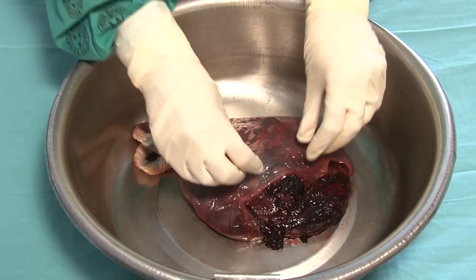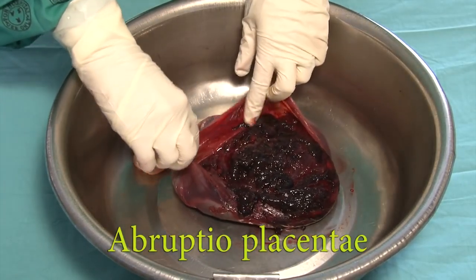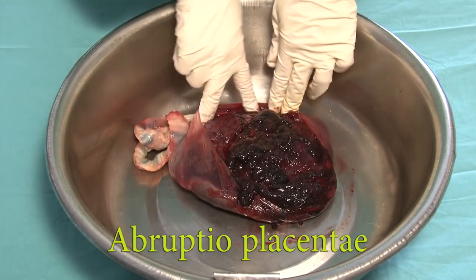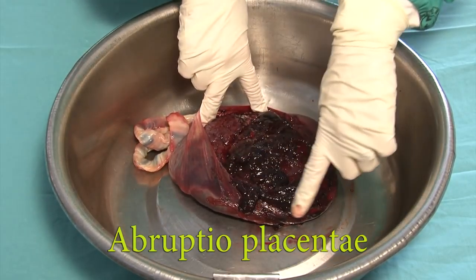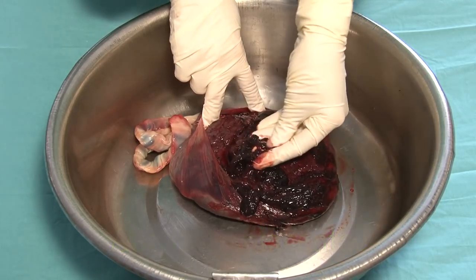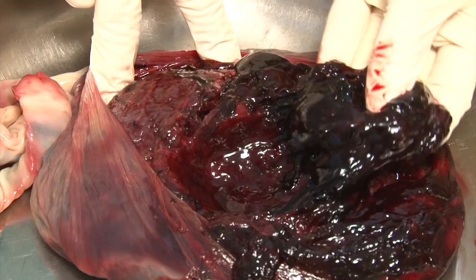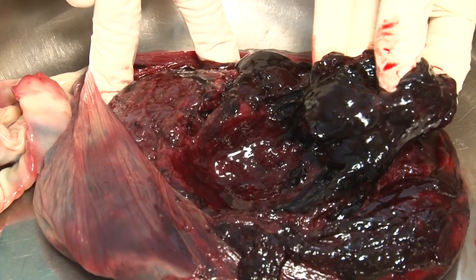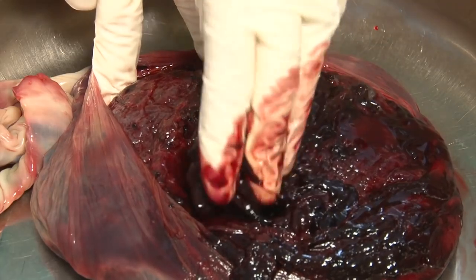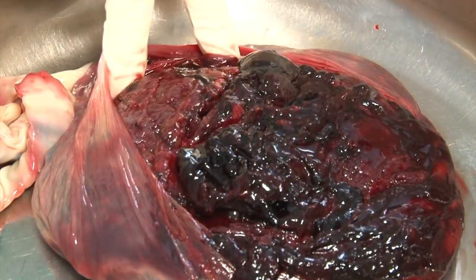The clots are almost black and organized, which means that the abruption must have happened a while ago. Here is an example of a large abruptio placentae. The size is defined according to how much of the placental disc is covered by blood. In this case, the abruption takes up over 60% of the placental surface. When removing the clots, the indentation into the placental tissue can be seen, which means that the clots must have been present for quite some time.